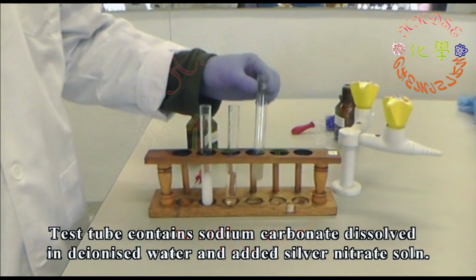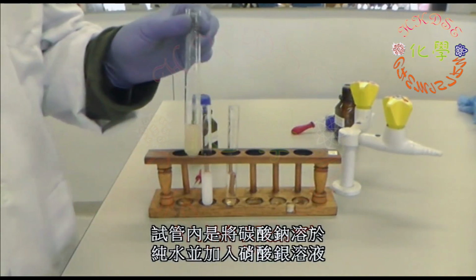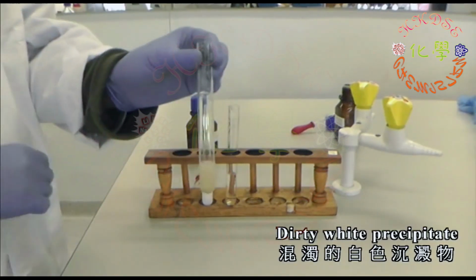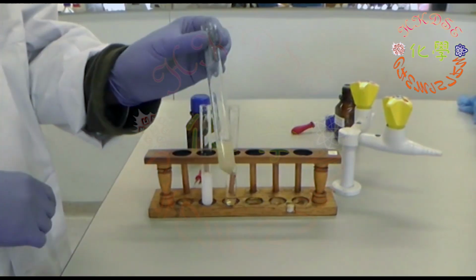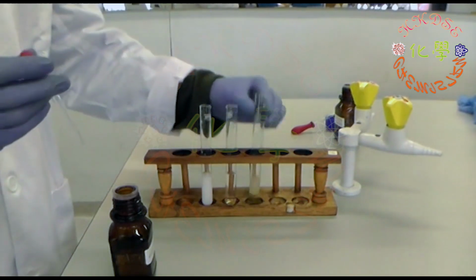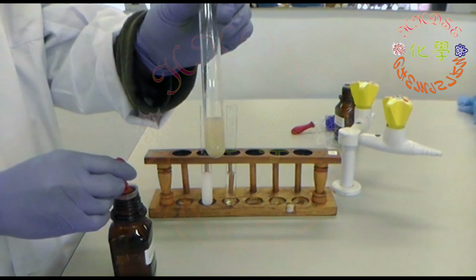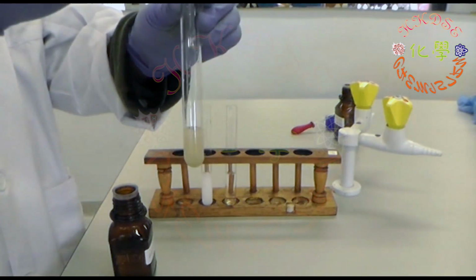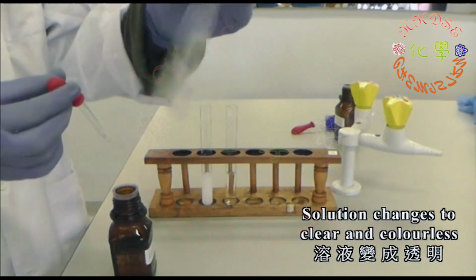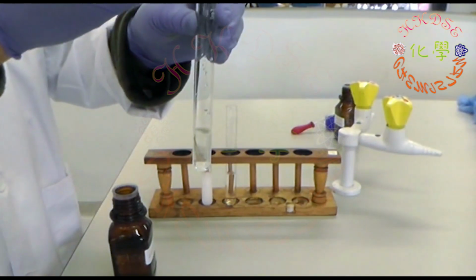The test tube on the right is filled with sodium carbonate, deionized water, and silver nitrate solution. The test tube appeared with dirty white precipitate. After adding the dilute nitric acid solution, the solution immediately became clear and colorless.